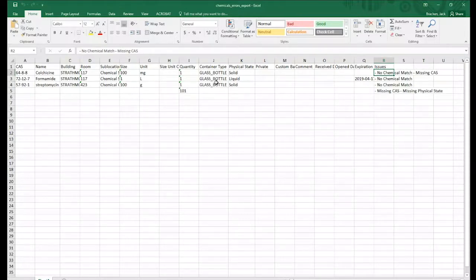So for colchicine here at row 2, I actually went and looked up the CAS number on the internet and found that it happens to be 64-86-8, not what you see here. I'm going to go ahead and correct that one now, and that should do it for that one. Now, formamide has a CAS number. It may or may not be incorrect.